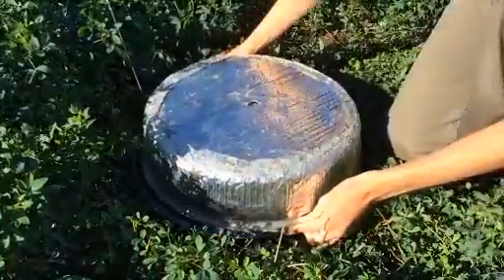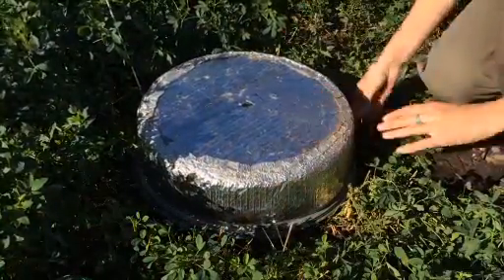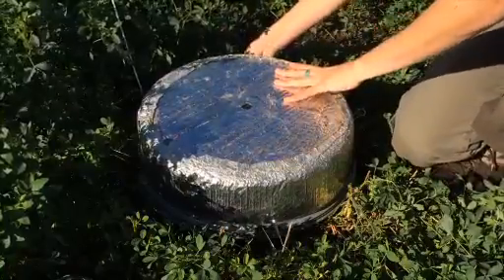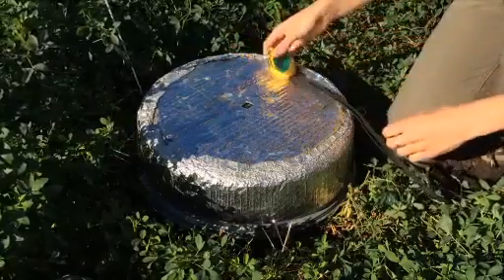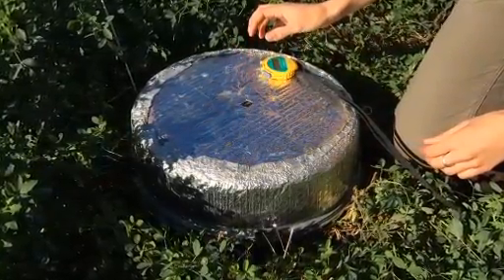At the first site to be sampled, attach and seal a chamber lid to the pre-installed anchor. Immediately after sealing the lid, start a stopwatch. This is time 0, or T0.